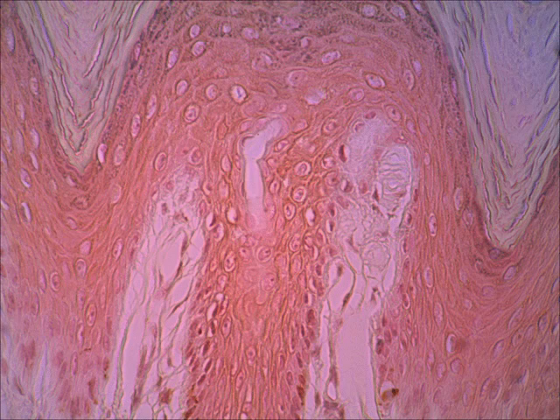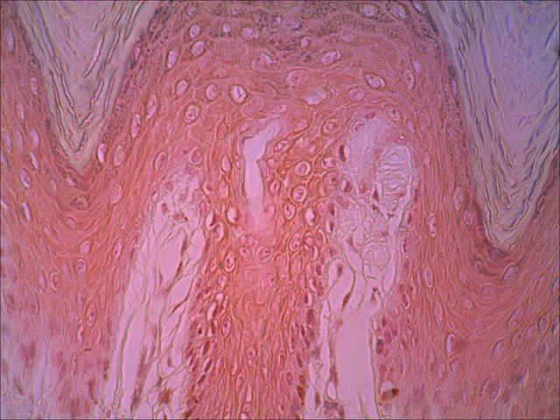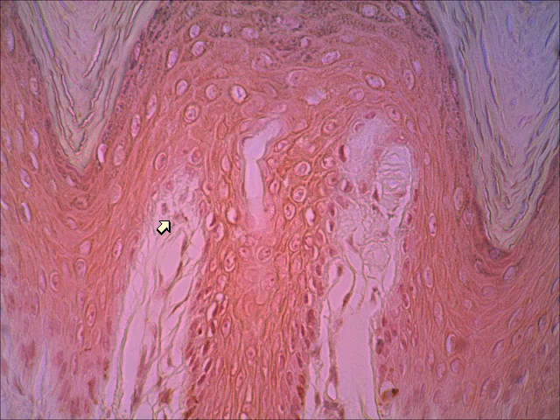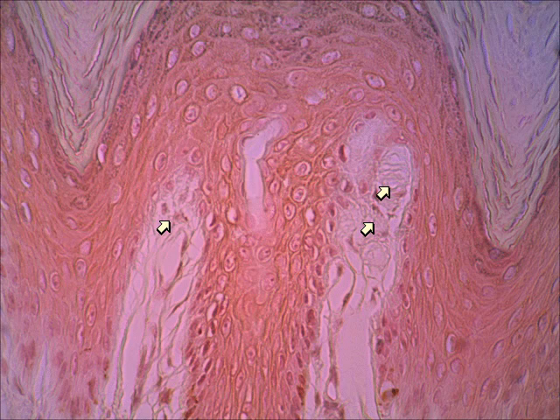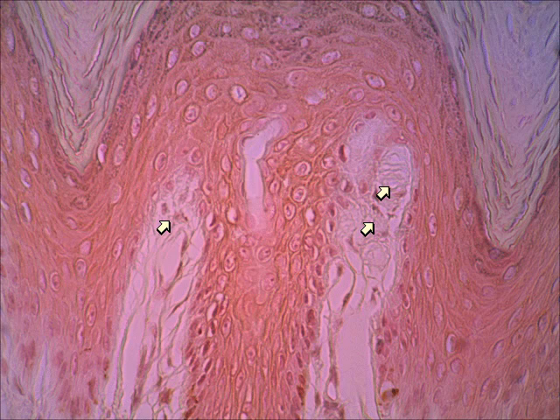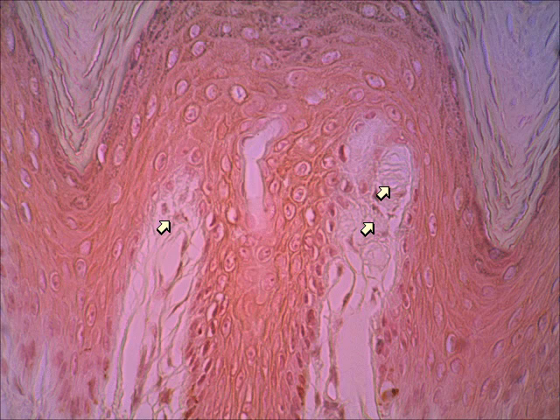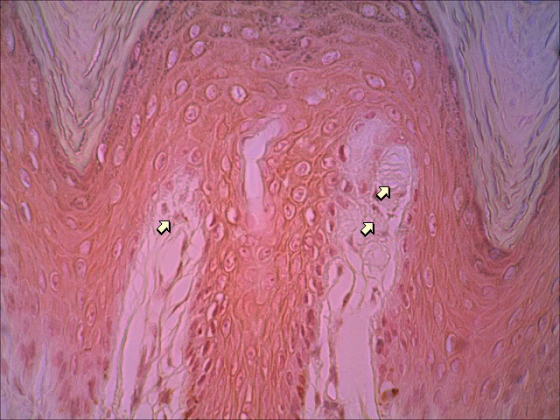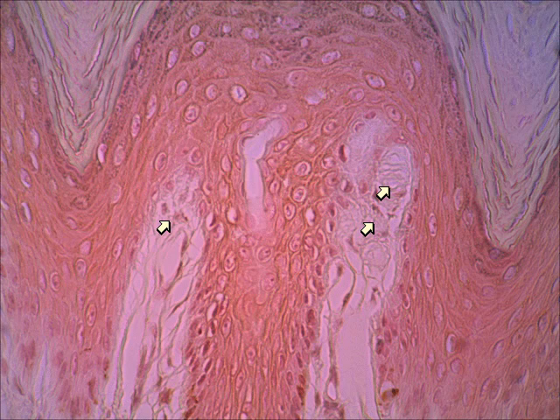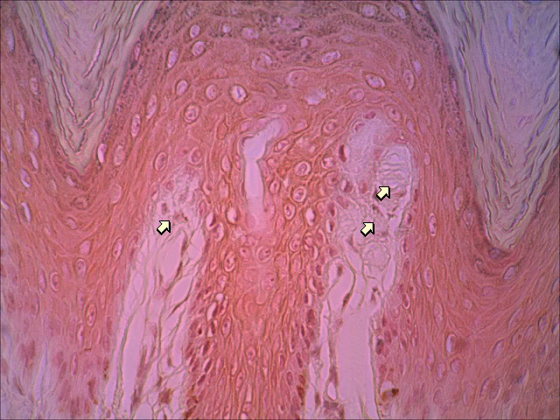There it is — I bet you can pick out the Meissner's corpuscle. Look in the lightened area where the dermis projects up towards the darker epidermis — that would be in a dermal papillae. Here's a dermal papillae; here's a dermal papillae. But within this second dermal papillae, right there, is a Meissner's corpuscle. Do you see what I mean by swirly? That's a really good view of a Meissner's corpuscle. Remember, these are sitting up high in the dermis, and because of their location, they can be sensitive to just light touch and texture.